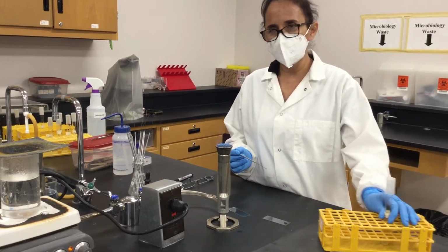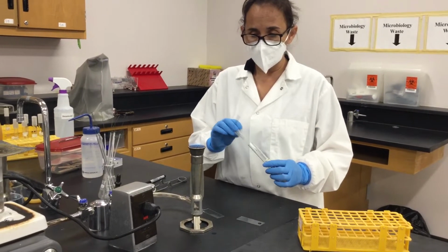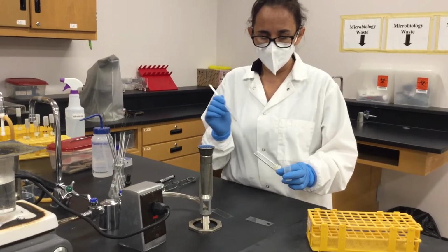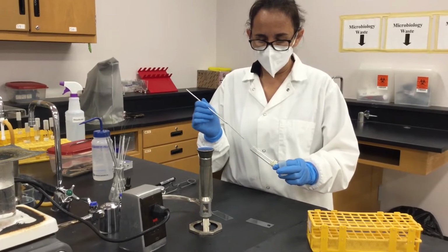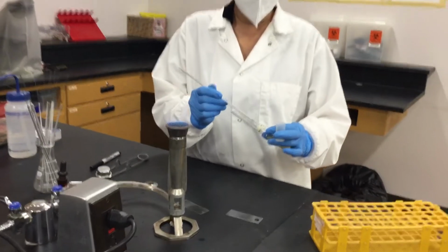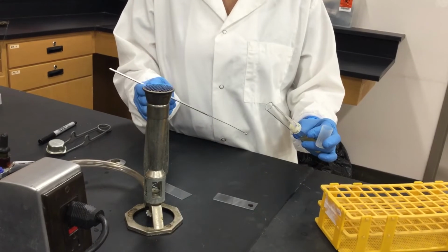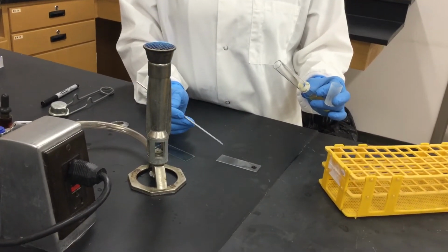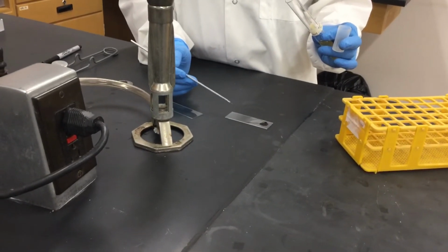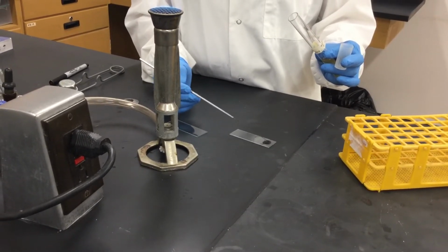And this is the same bacteria that we use for the negative stain. So you pass the opening and the cap, the opening of the tube and the cap twice through this flame, grab the inoculum and then transfer it into your drop. Make a homogeneous mixture, circular motion, and you don't require as much bacteria.